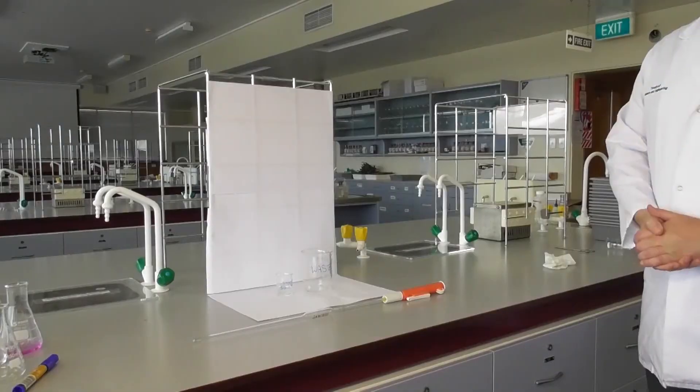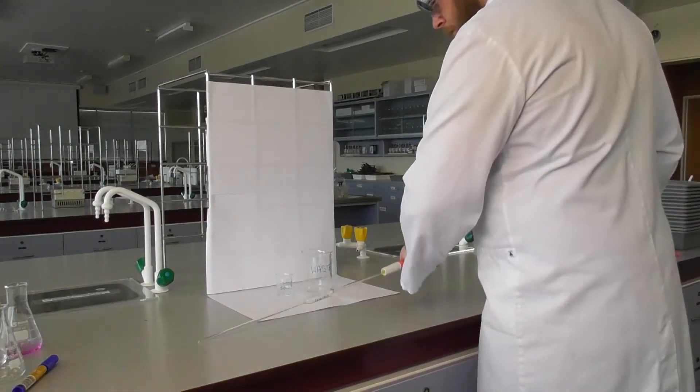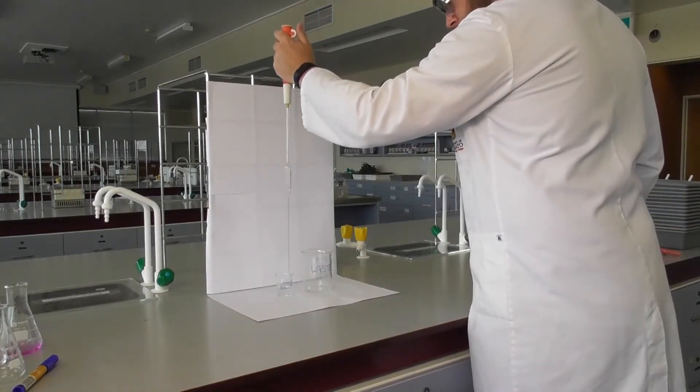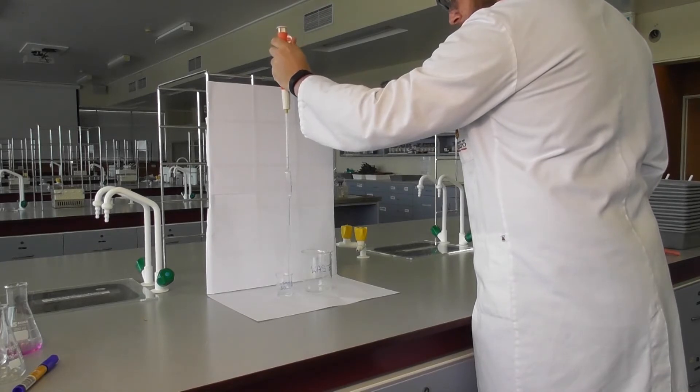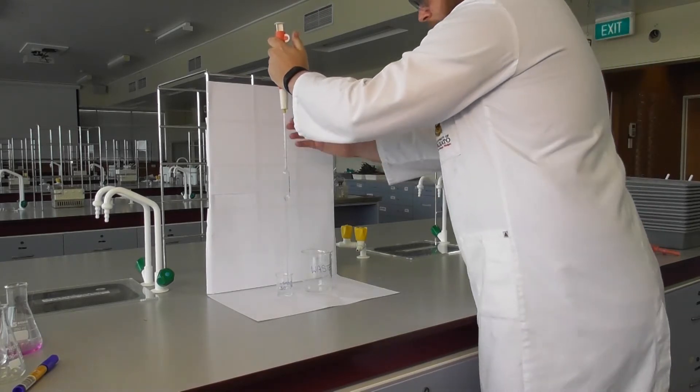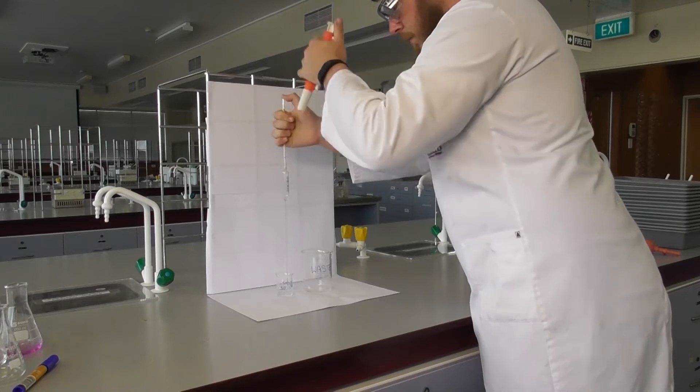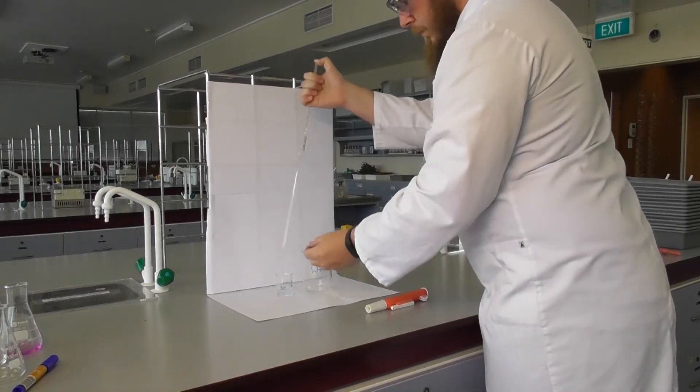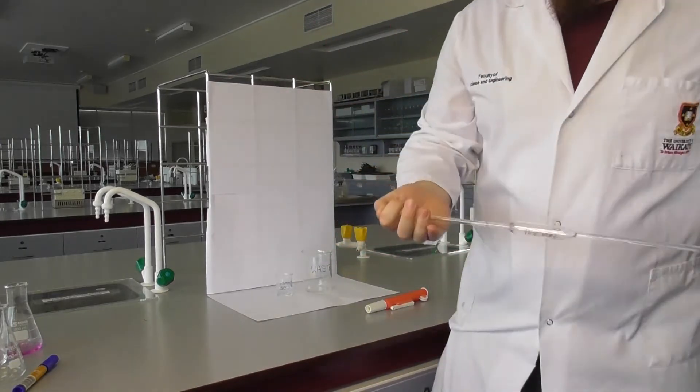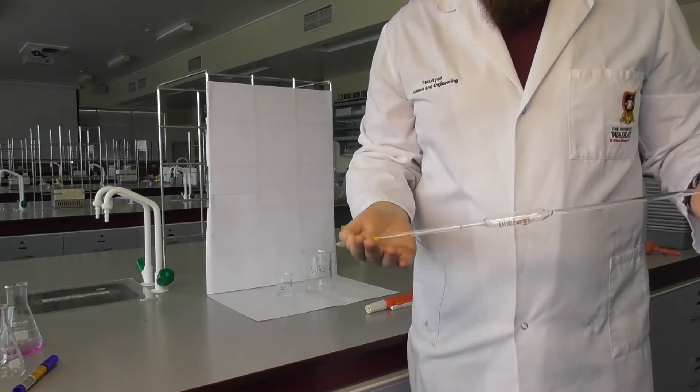With a pipette filler, draw some of the solution to be pipetted and use this to rinse the inside of the pipette. It's not necessary to completely fill the pipette during this step, as you will tip the pipette back and forth to ensure the inside of the pipette has been rinsed.